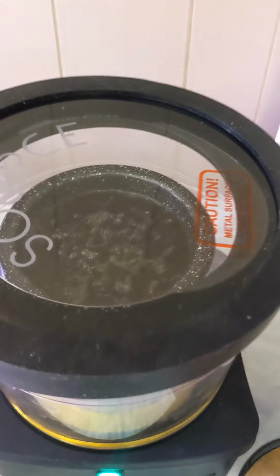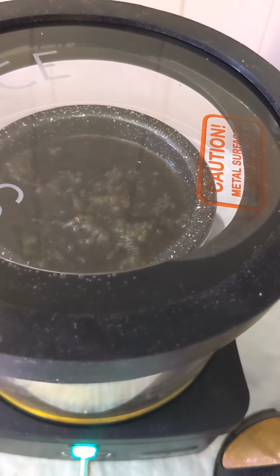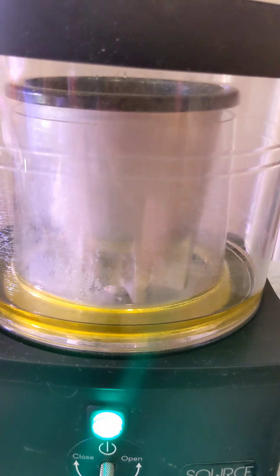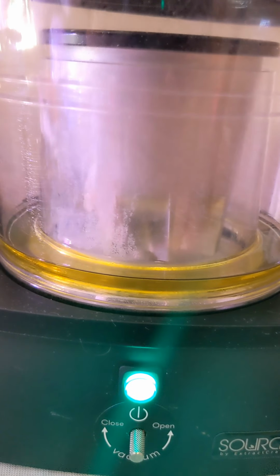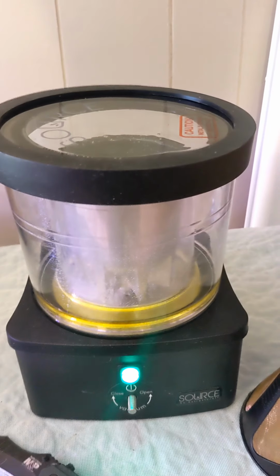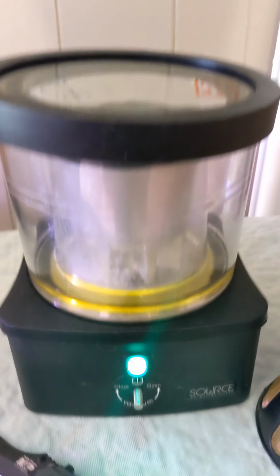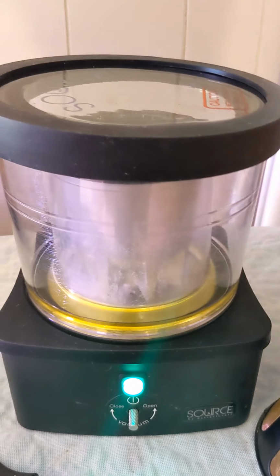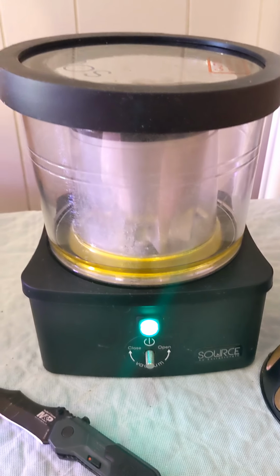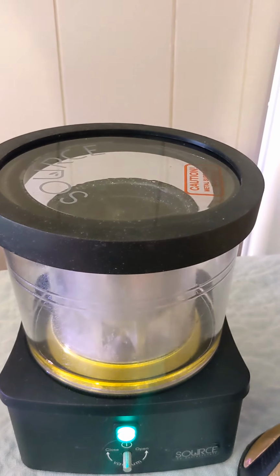Apparently it takes 4 hours to empty it if you have the crucible full. For this run, I'll probably be filling that crucible up 3 or 4 times and just continuing to run it. Obviously I'll have to empty this out in between, so we'll have to see how that works to run larger batches like that. But I plan on testing this out lots while I have it. I hope to have it for maybe a month. I'm not quite sure. My buddy lives a bit of a distance away. He was here for Christmas, and then we're going into this lockdown in Ontario, so it's going to be a few weeks anyway, I believe.